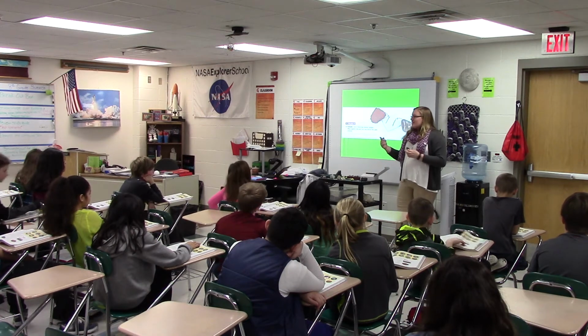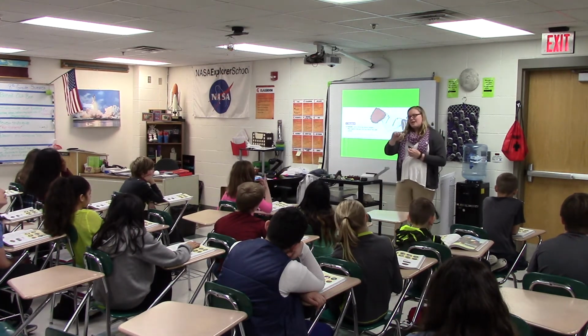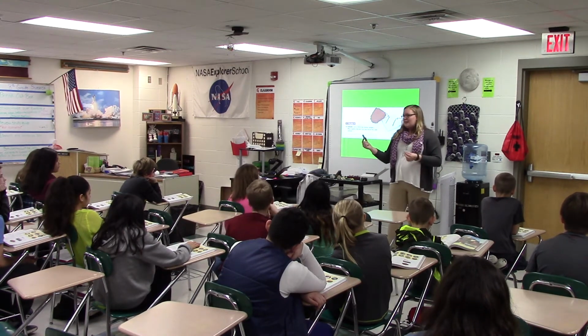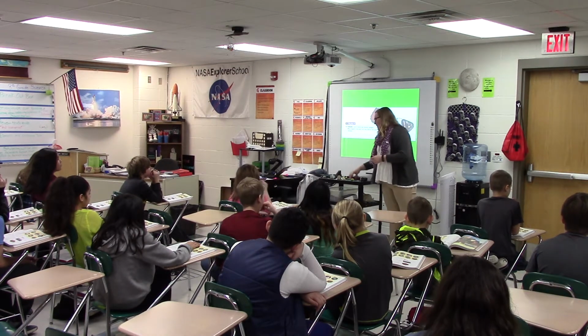So first, I always want you to test with this white porcelain one, but if nothing's showing up, try doing it on this black one. It might have a white color or a really light color.